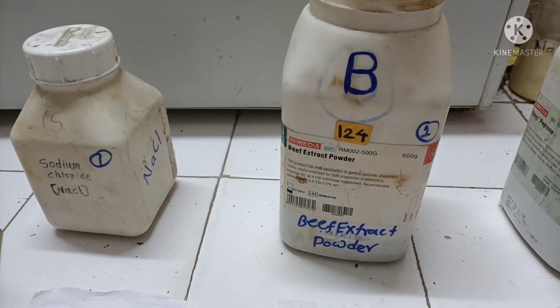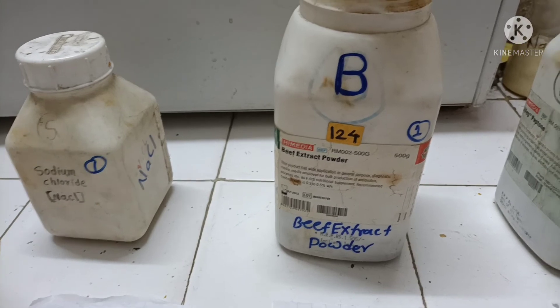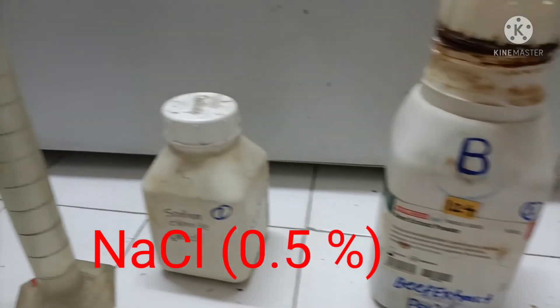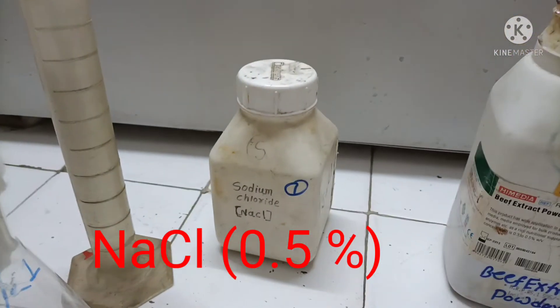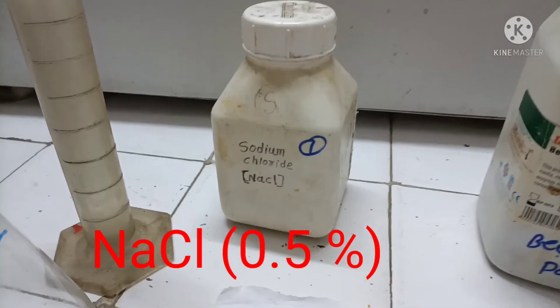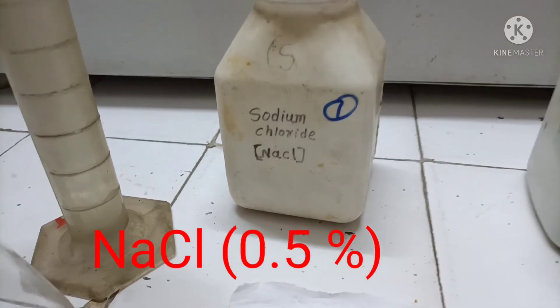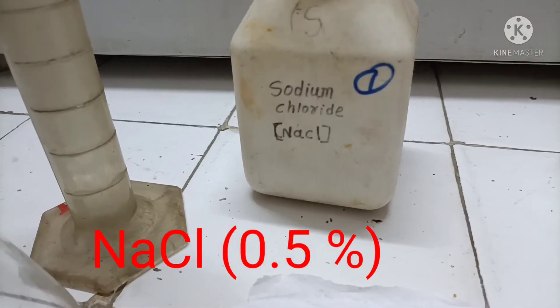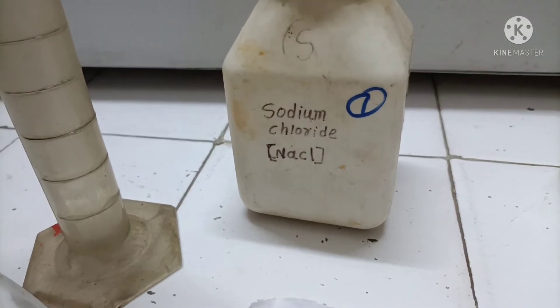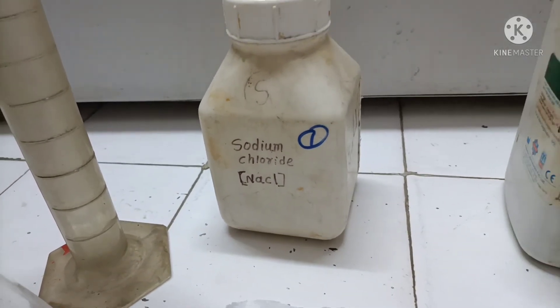Another ingredient is NaCl — sodium chloride. Sodium chloride is also added into the medium at 0.5 percent to make the nutrient agar.